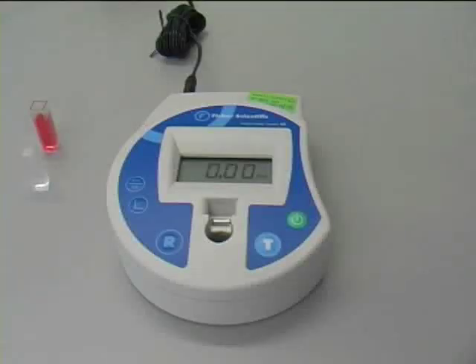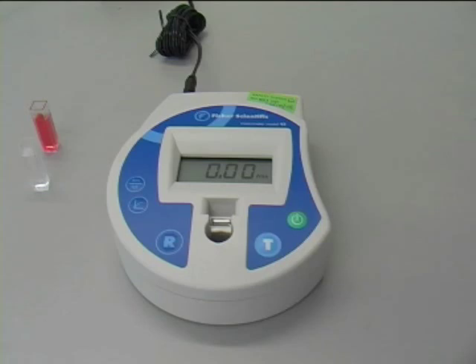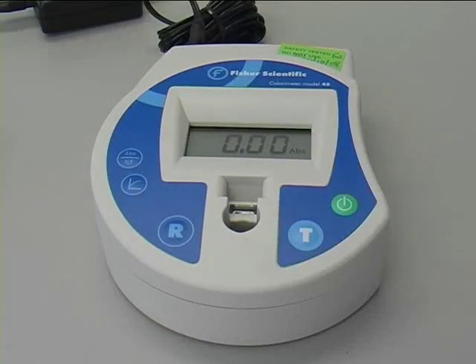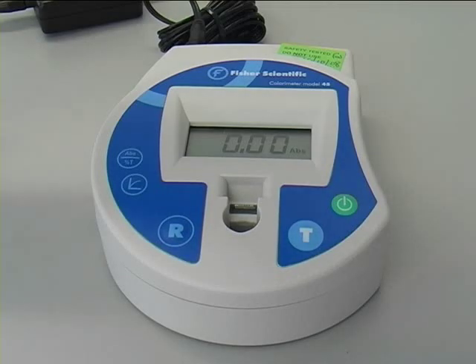The light beam of the colourimeter passes front to back, so if using two windowed cuvettes, the clear windows must be front and back when the cuvette is inserted in the colourimeter. The first step in making a measurement is to reference the colourimeter.